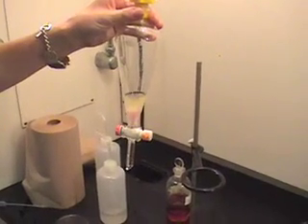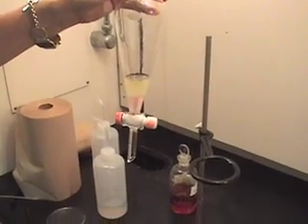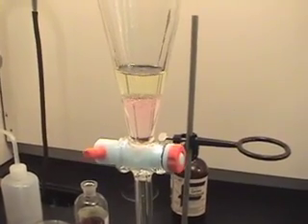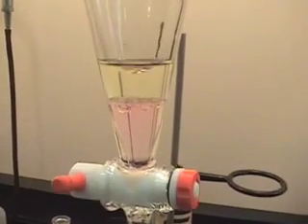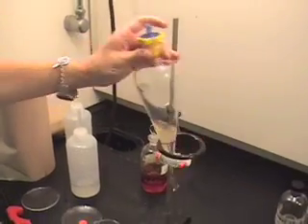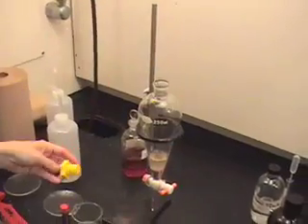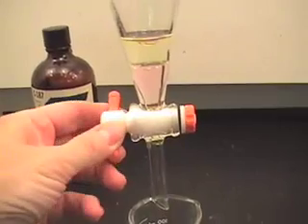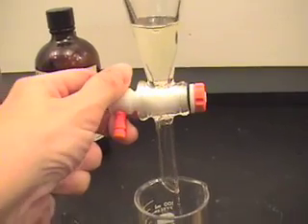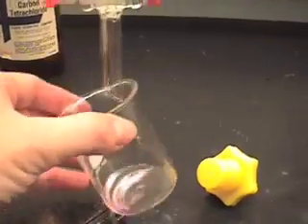Evidence of a chemical reaction could possibly be a color change, but in this particular case it isn't. Iodine dissolves in water to be sort of yellow when dilute, but it dissolves in carbon tetrachloride to be pink. The pink layer is on the bottom. Using a separatory funnel, I can remove the pink layer by simply opening up the bottom. Decanting removes the top layer; a separatory funnel removes the bottom layer. Both take advantage of differences in the densities of the two layers.